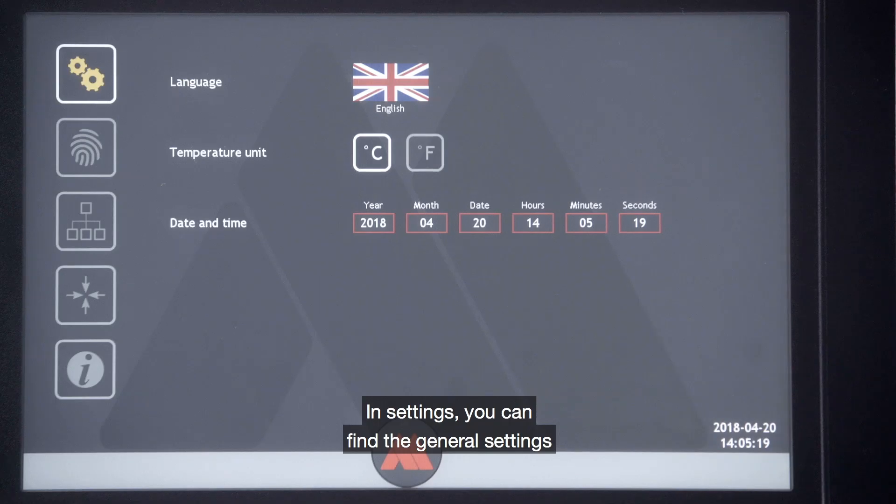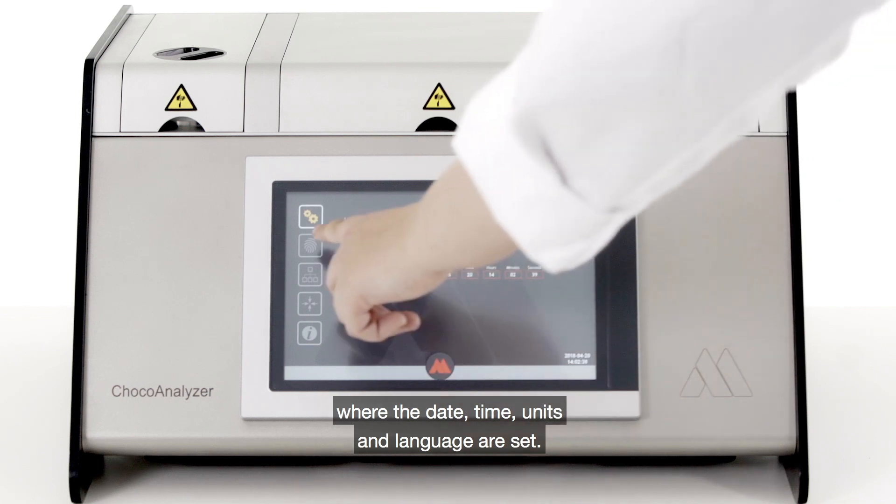In settings you can find the general settings where the date, time, units and language are set.